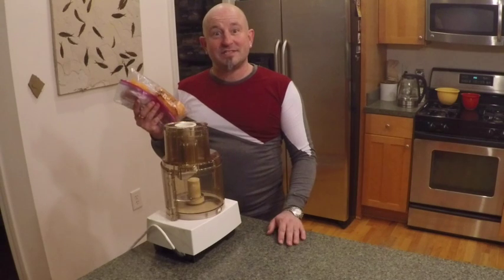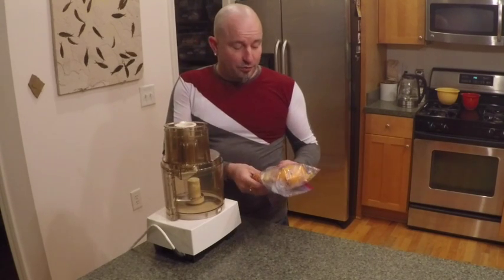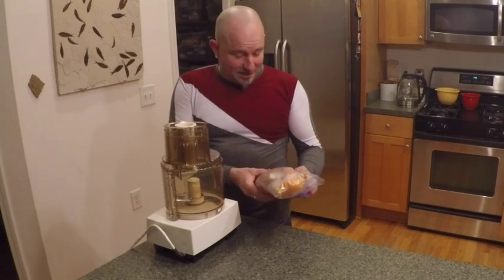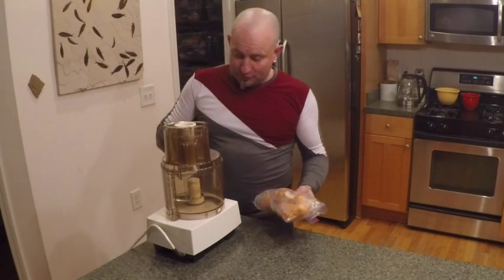Hello, I'm Jason Lyme and we're going to be steam distilling some orange oil today. I've been saving up my orange peel in the freezer and we'll chop it up and then put it into the steam distillation.